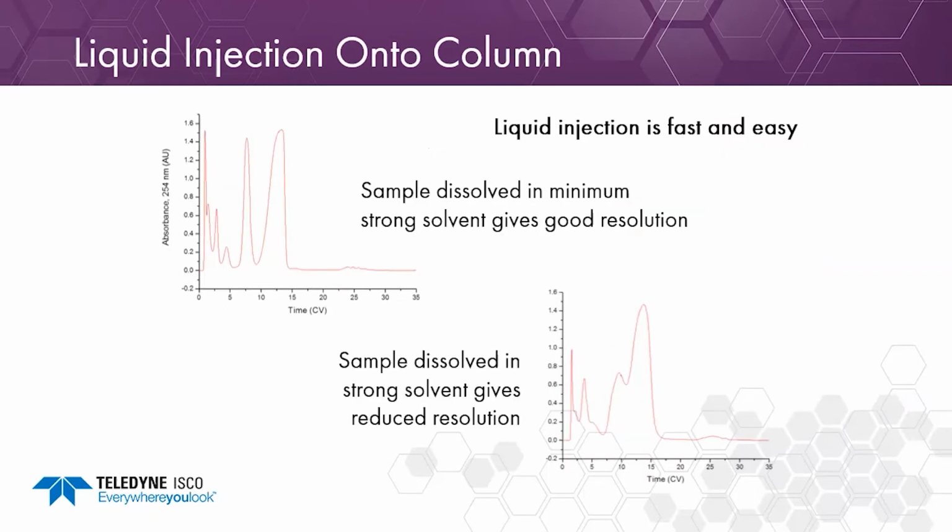Here's some examples of liquid injection onto the column. You can see we dissolve it in the minimum amount of strong solvent. We get good resolution, baseline resolution between the peaks. And then as we increase the strong solvent doing the liquid injection, basically, you can barely see that there's 2 peaks there, and there's coelution.